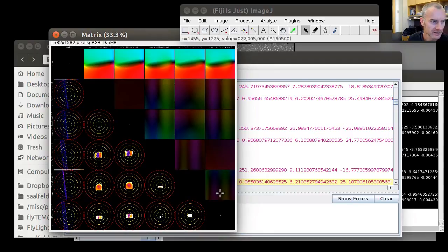So on one side of the matrix, the upper half, we see a color intensity projection of the amplitude and the orientation of the displacement field across the field of view of one image. This is compared to an identity transform, so this is obviously dominated by some stretch or bias that is not particularly interesting in this case. But this part here of the matrix is interesting because it shows us the relative differences of lens correction models across the individual channels. What we see here is the relative differences plotted into a circle diagram, 2D, so we see where it's going, if there's a shift bias or something like that.